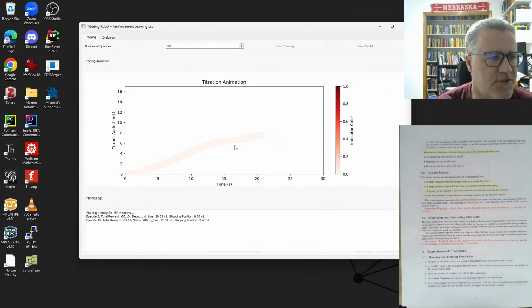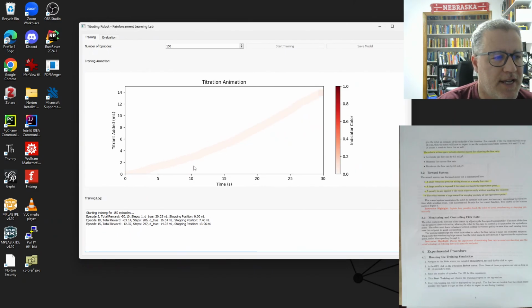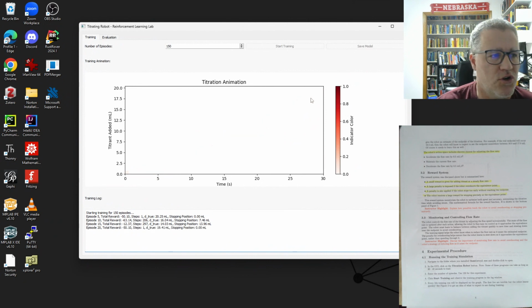And first we see, so here's a good example here. Every fifth one is going to show up, and you'll get the results down here and kind of in visual form. So we can see this is sort of the path it took. So very kind of a slow slope, and didn't do so well. I mean, it stopped a little early. Here, did a little better. You can start to see the color getting closer to that indicator, although stopped still a bit early.